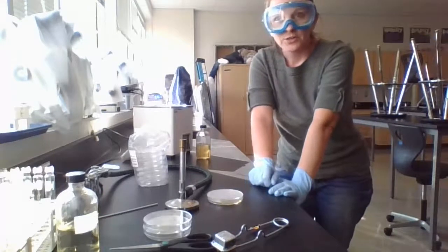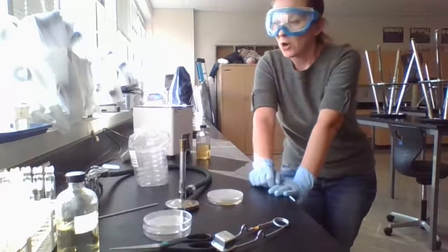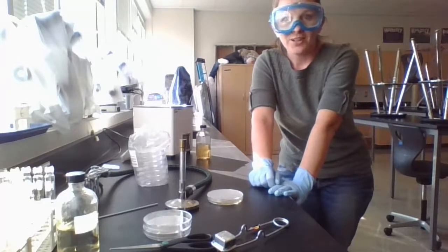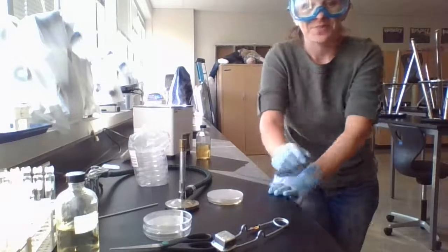All right, so that's it. We've just poured our first agar plate, and we've used the Bunsen burner for the first time. So hopefully as we get more and more into this here, you'll have a little bit more practice with this, and we'll be able to actually do it in real person. Thanks.